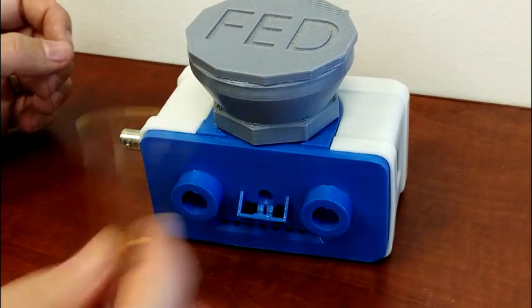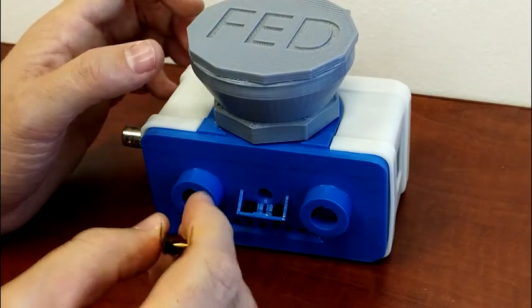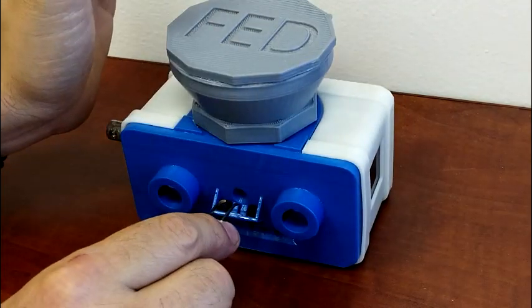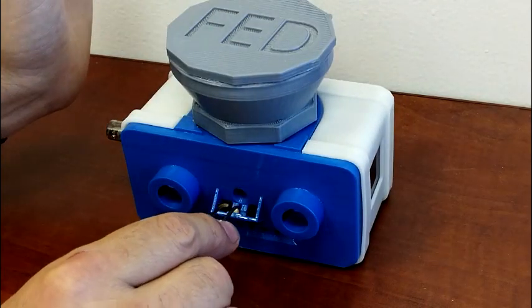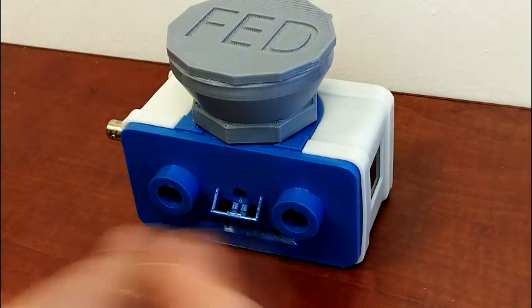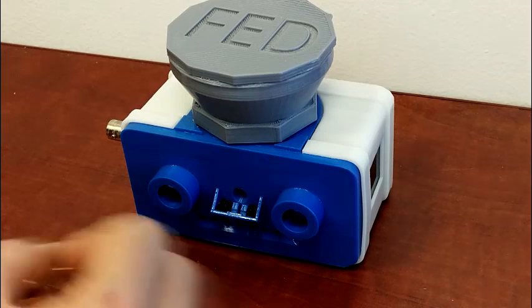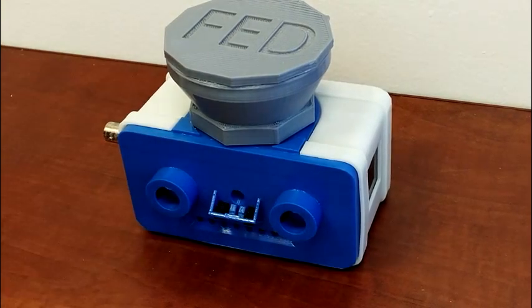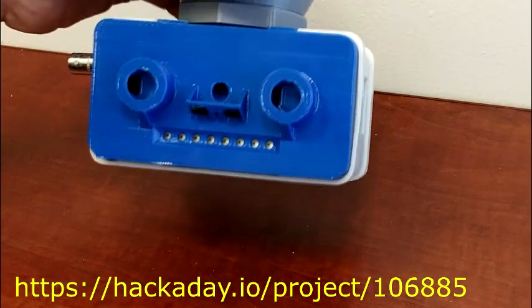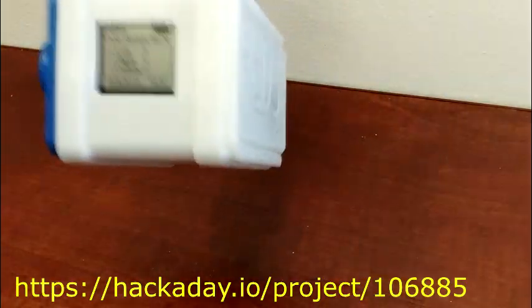we get pellets. After getting 8 in a row correct, this task, the active poke will switch to the other side. And the animal will have to learn this reversal. So those are the programs in the FED. I'd love to hear any feedback.